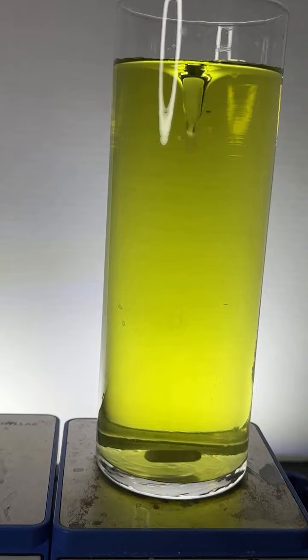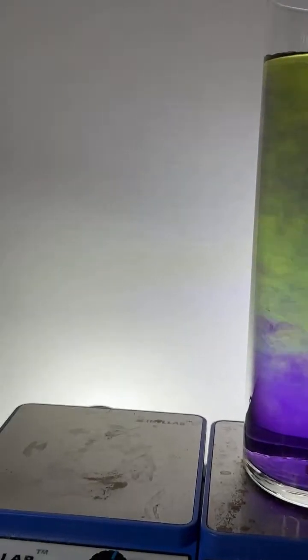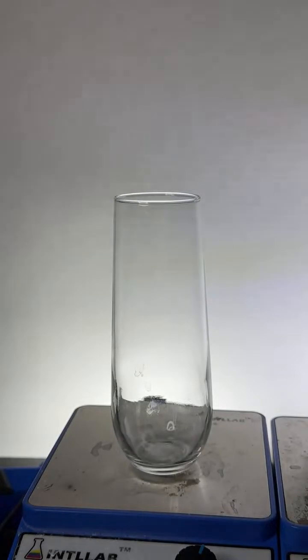So folks want to try vegetable oil and an Alka-Seltzer tablet with a little bit of water is what I'm hearing. Let me see if I can get that set up, okay? We'll try it just to goof around. All right, hold on a sec. Let me get a little flask, and we'll try this. What size flask am I going to use? I'm going to use a small one because I don't want to make a huge mess. I got my vegetable oil. Where's my vegetable oil? Here's my vegetable oil. I got my water. Okay, here we go. If you guys want to try it, we'll try it. Little smaller flask.